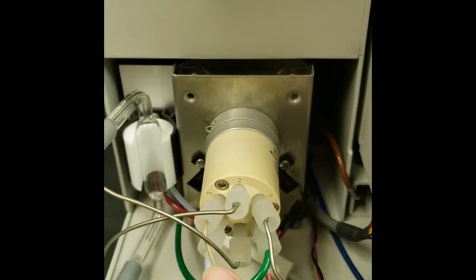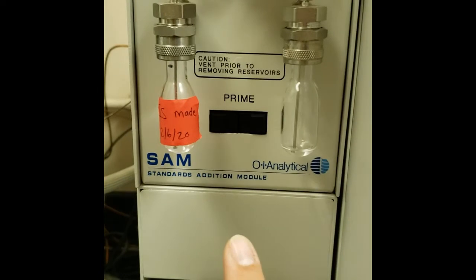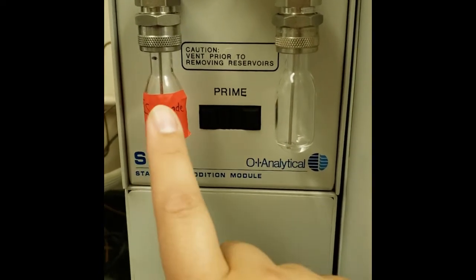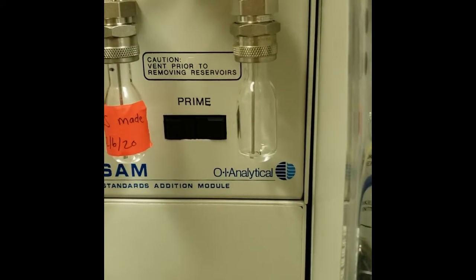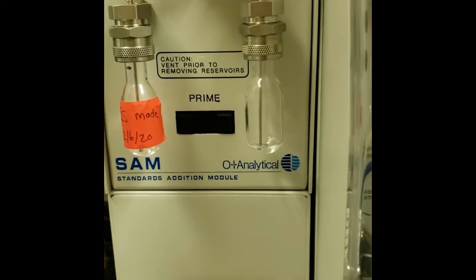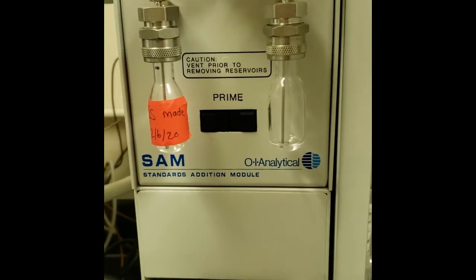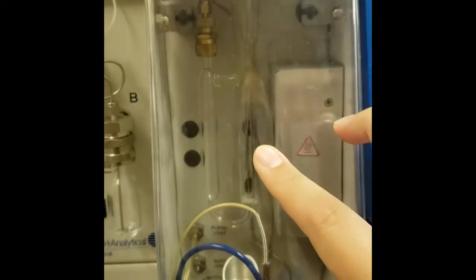We also have the SAM unit, which is our internal standard. What that will do is inject 1 microliter of our internal standard. If you have a mass spec site, then you'll have 3 compounds, so the 1 internal standard and 2 surrogate compounds. If it's an FID site, you'll just have 1 compound. And so then that will get injected into your sample in the sparge vessel.